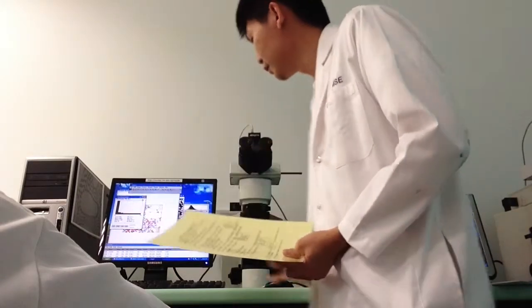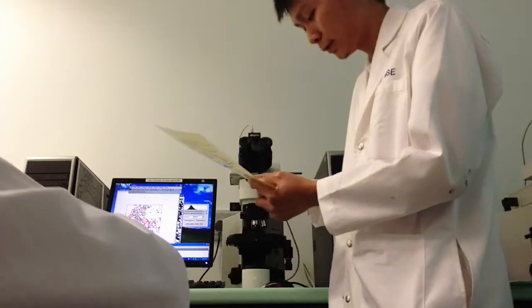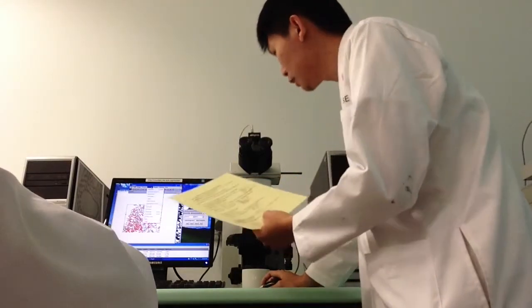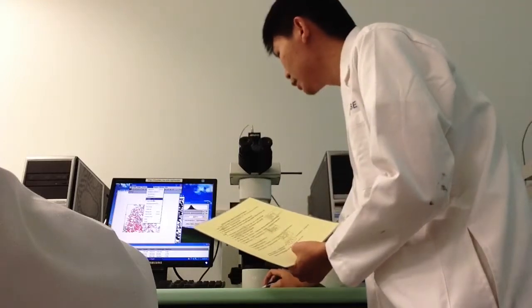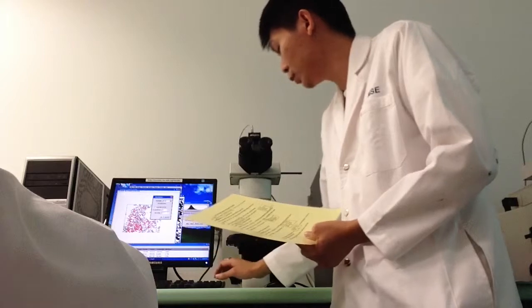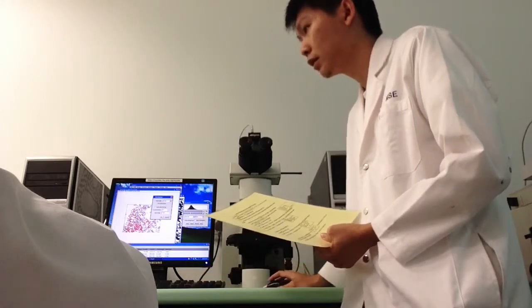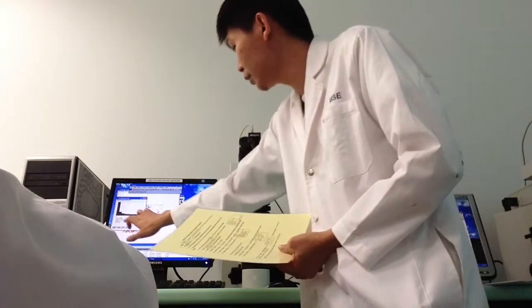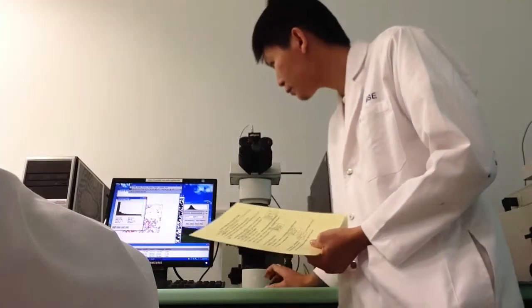So I will just do step number 16 again. Go back to click analyze distribution. Here, instead of 100, you put 40. So you should see that this area is already blown up.